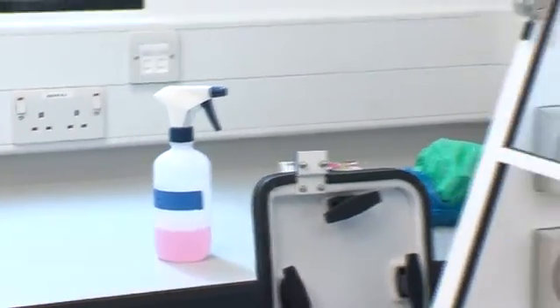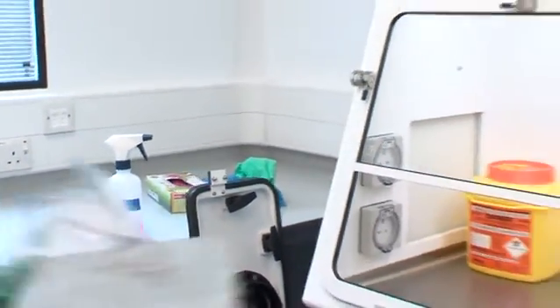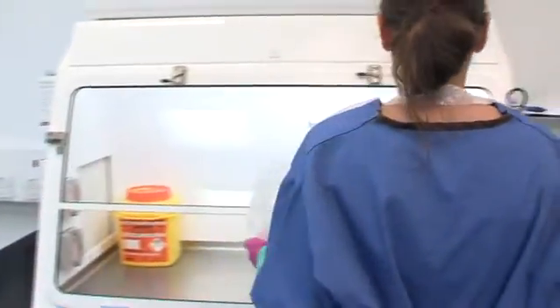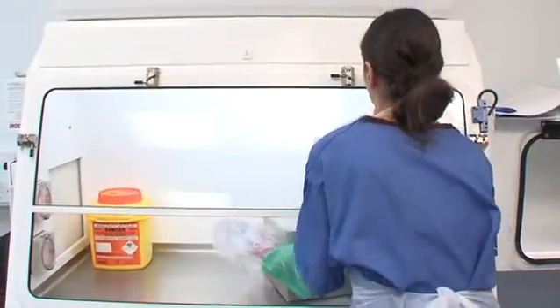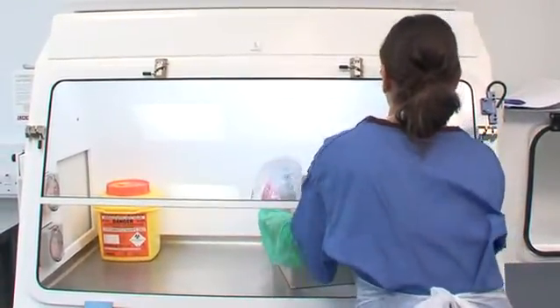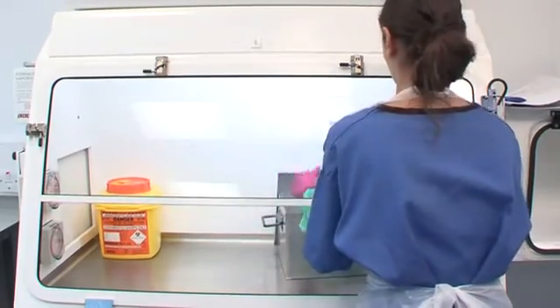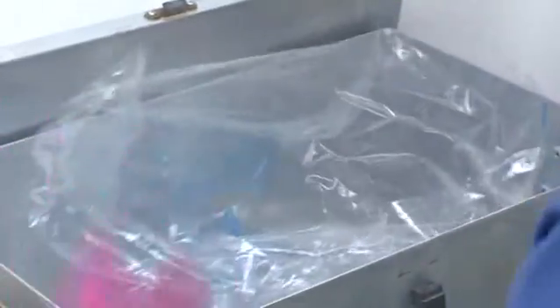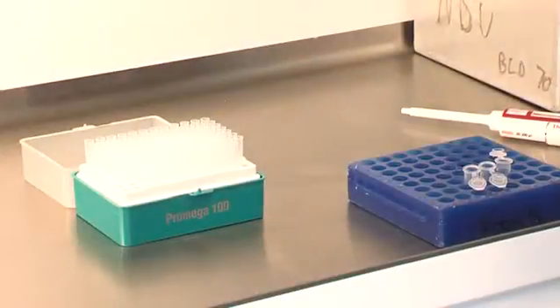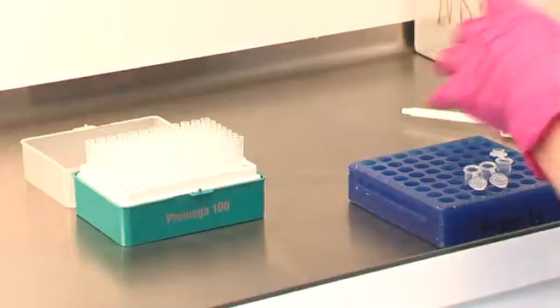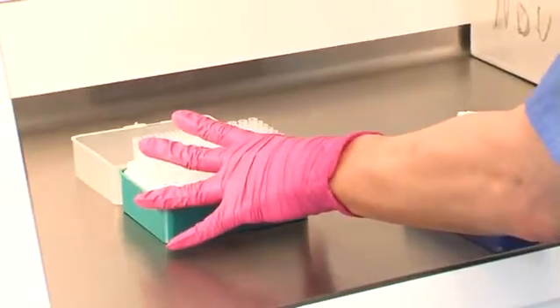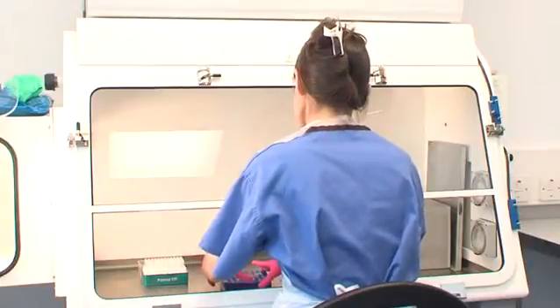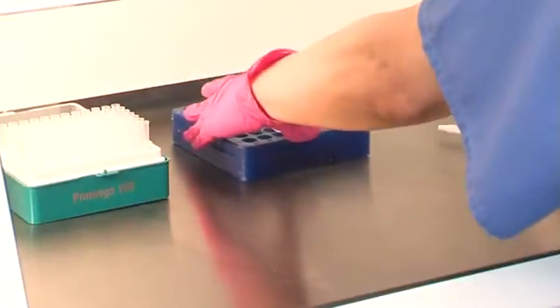Prior to commencing work laboratory staff must ensure that in-date decontamination materials are available in or near the cabinet. Disposal methods required such as a sharps bin, decontamination tank and waste bag must also be available. All materials should be placed as far back in the cabinet as practically comfortable, towards the rear edge of the work surface.